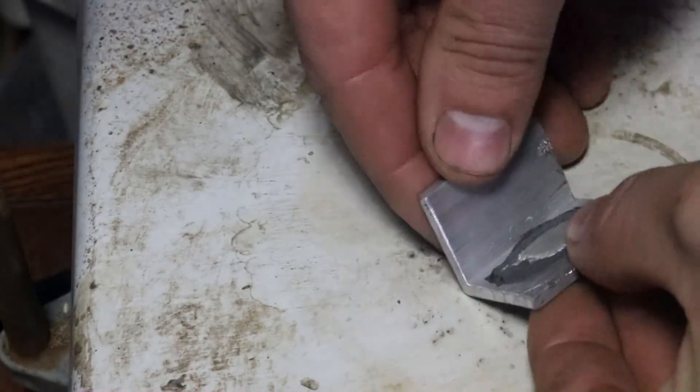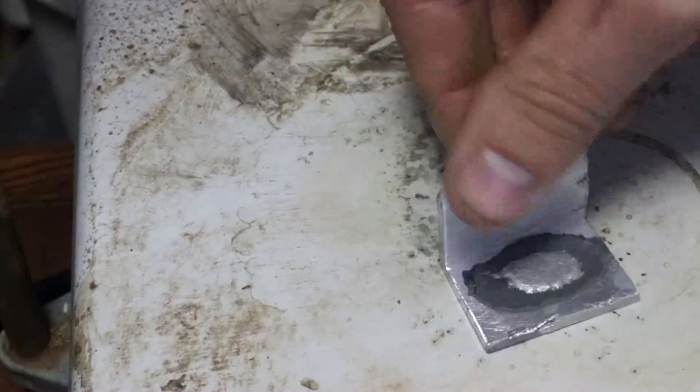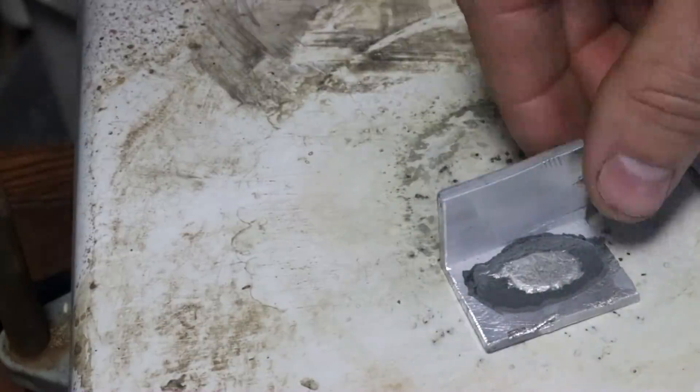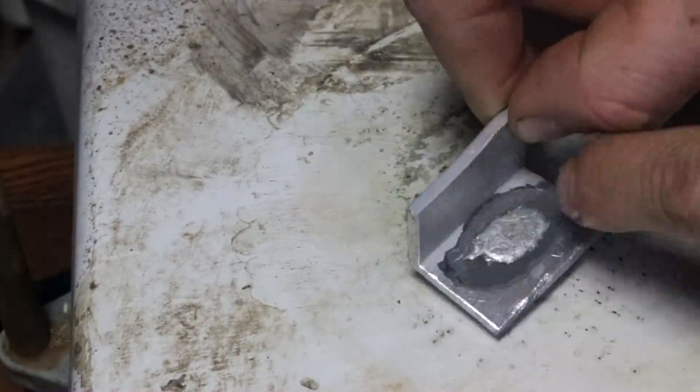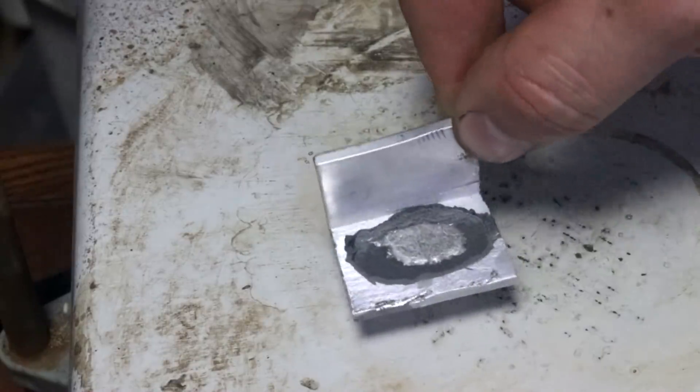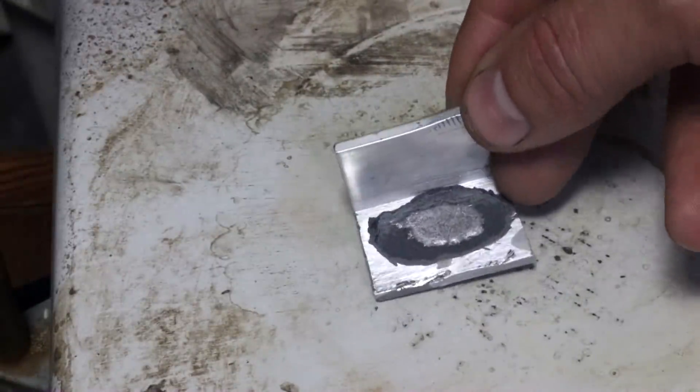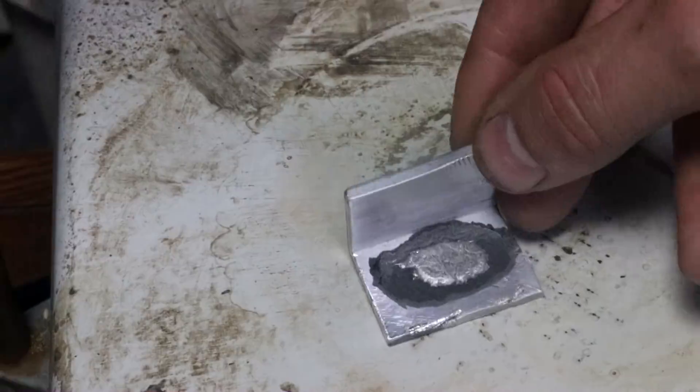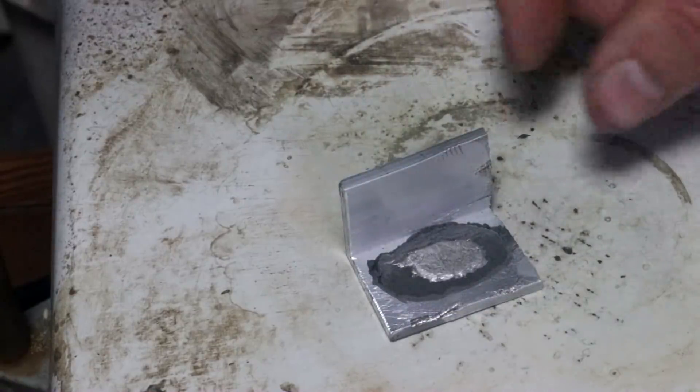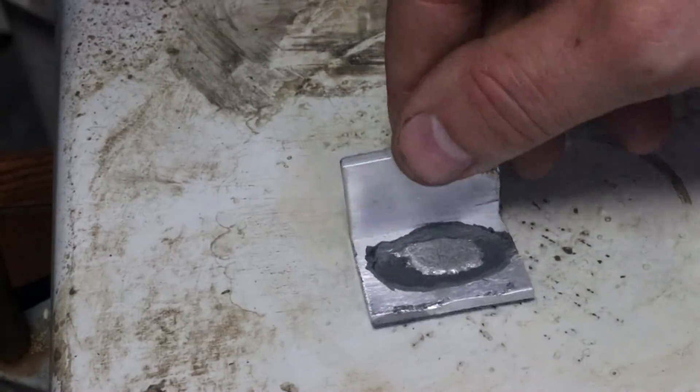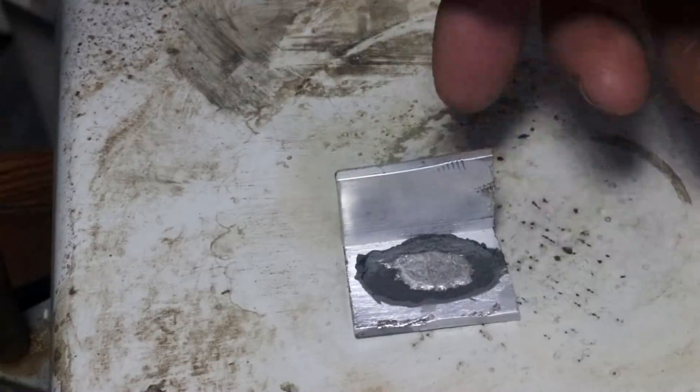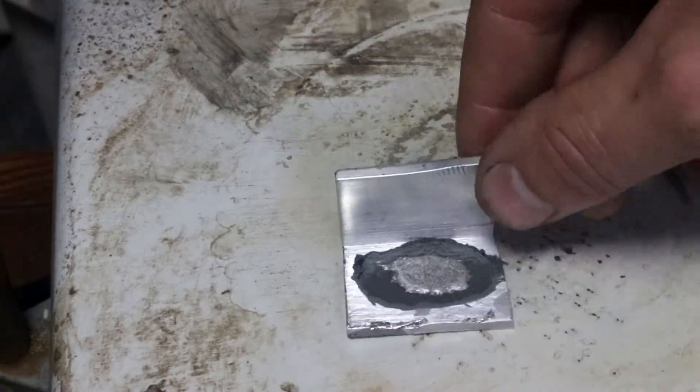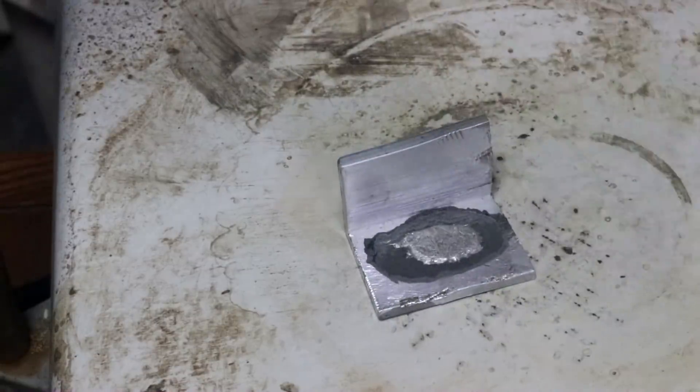Yeah, the aluminum is still quite strong. That makes sense because it hasn't destroyed or interacted with the majority of it. But this is proof that the fields metal will attack aluminum. So let's turn the hot plate back on. Let's let it sit on here for a few more hours with the metal liquid and see if it soaks through even more.